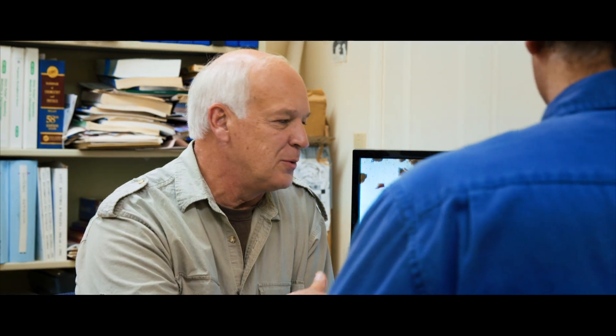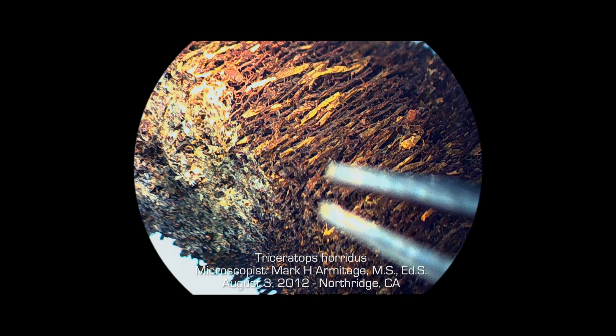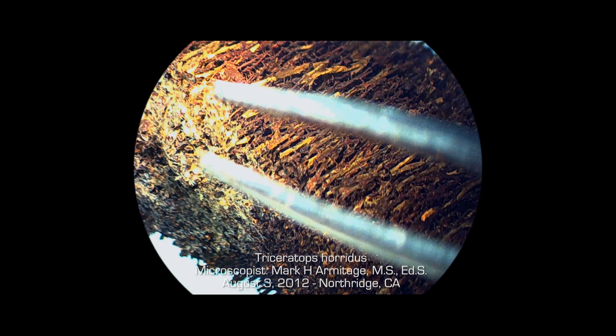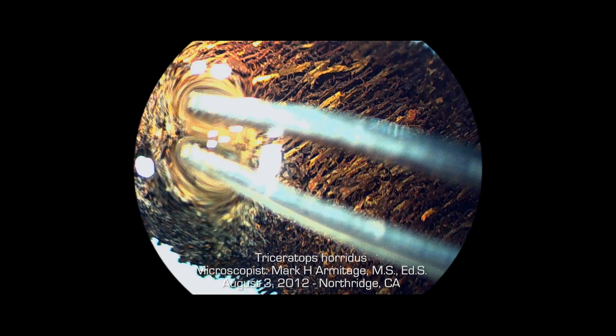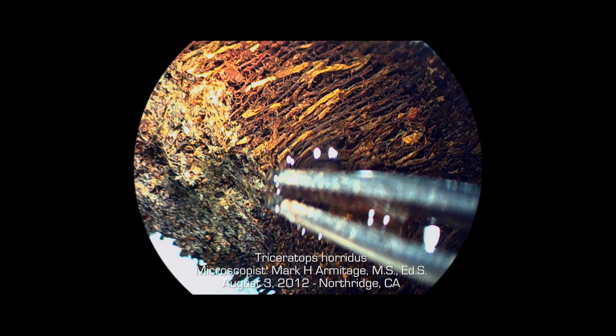Well, Kevin, what did you find when you were looking at the sample and you actually found some tissue? Here's what we found. Here we have a piece of the horn that has been decalcified, like what I just showed you over on the bench. Mark Armitage was our microscopist working on this. Mark then took a piece of the decalcified horn and put it under a microscope. See the fibrous material there? That's part of the composition of the bone matrix itself.